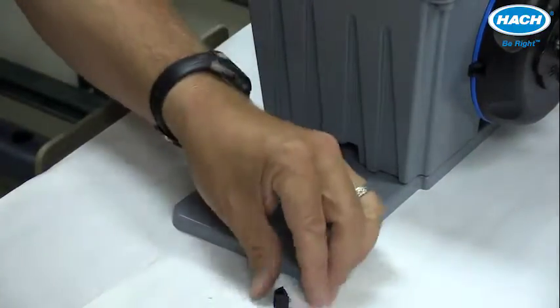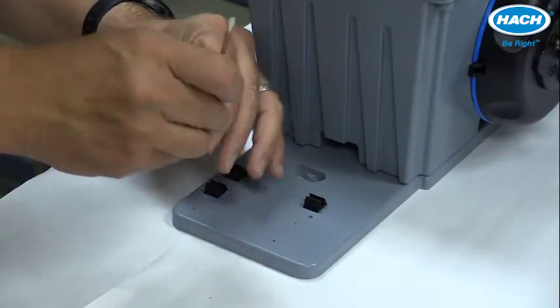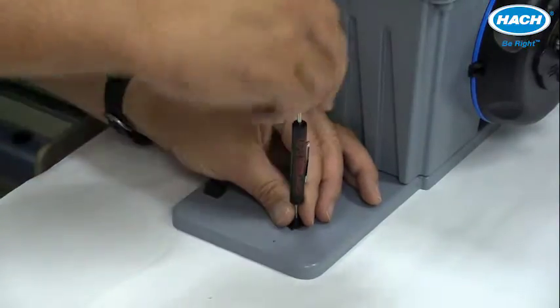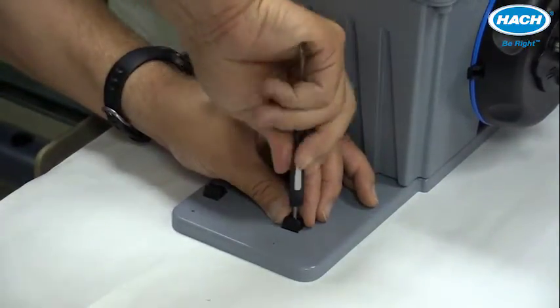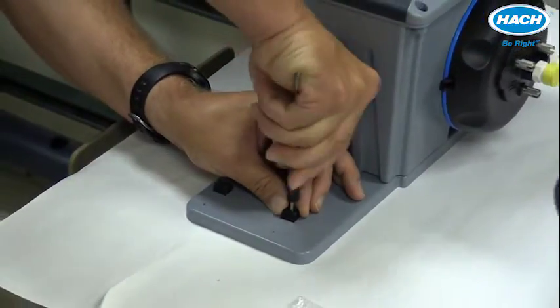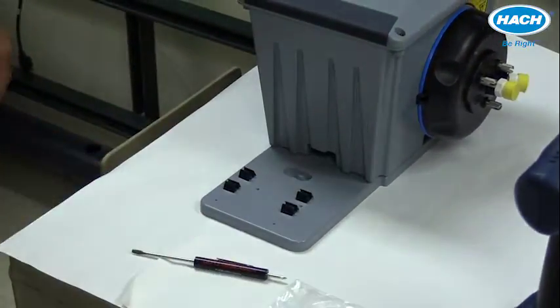Tighten down those screws and we're done.